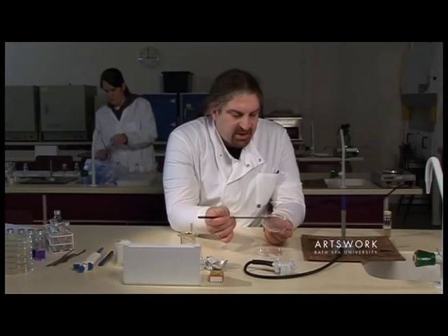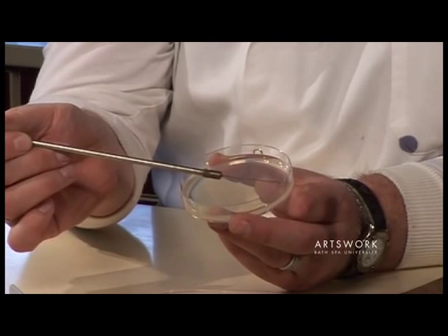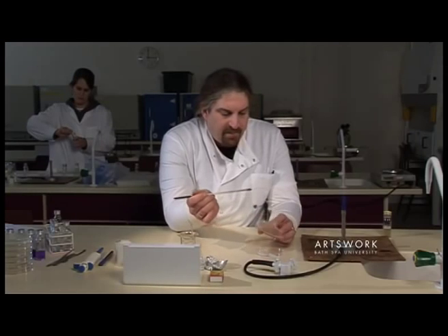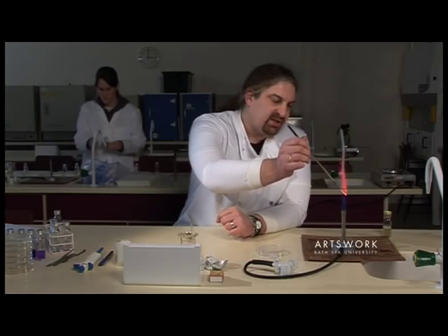Touch that onto the agar plate and rub it out slightly into a little dot, then go back and sterilize the loop again.